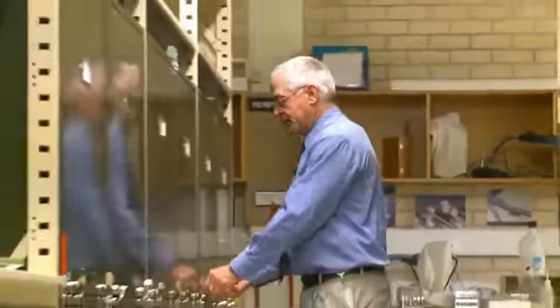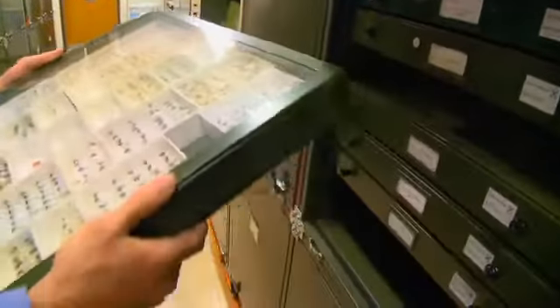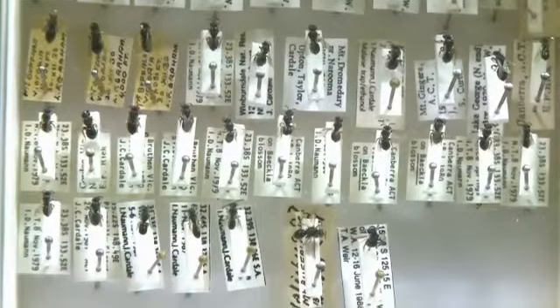One of the applications is to be able to understand the biodiversity in a local environment. Another is in conjunction with CSIRO entomology. They've got a huge collection of insects that are used in pollinating, so not just bees but beetles. And we're hoping the instrument will be able to assist in the assessment of what species are important to which ecosystems. Right now there are over 1,300 different species of bees in Australia, but for the most part we don't know what they're doing and how they're doing it.